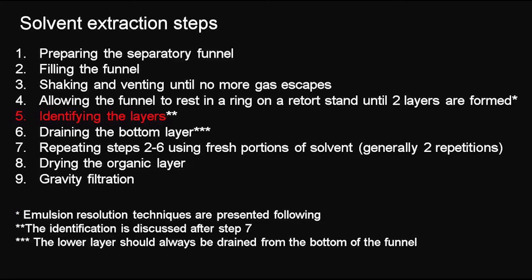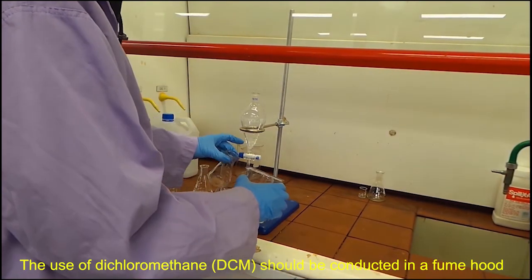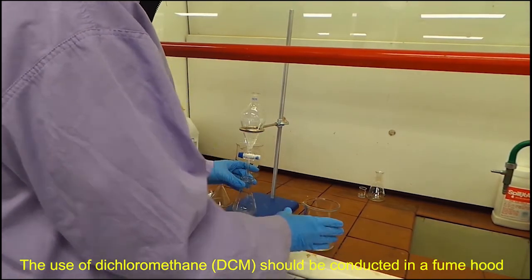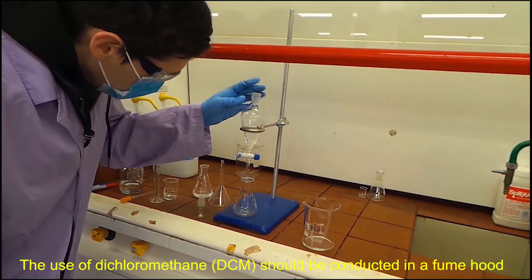Now you need to collect your sample. The liquids are separated based on density, so the highest density will be on the bottom. In this case, DCM was used which has a higher density than water, so the product is on the bottom.